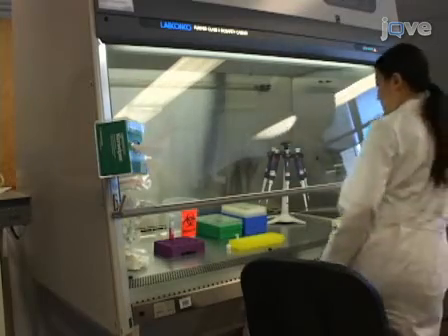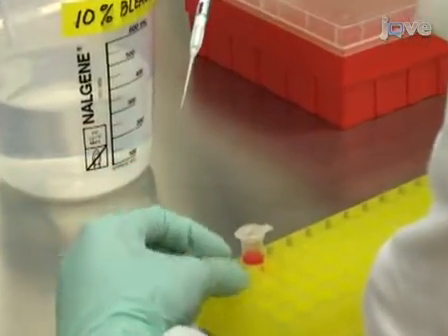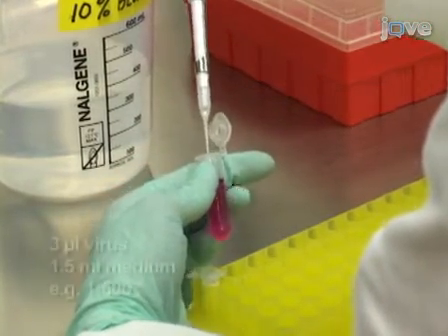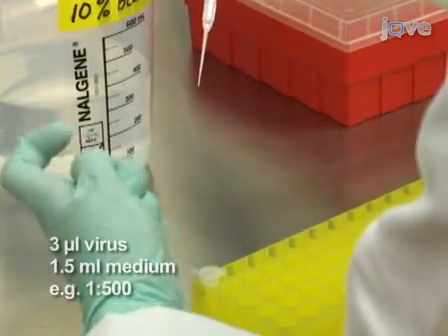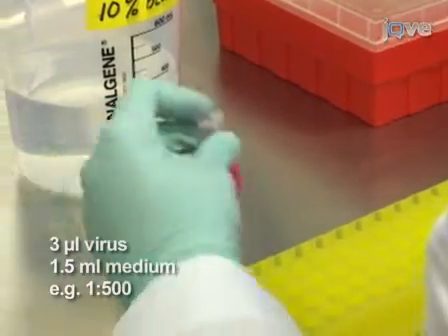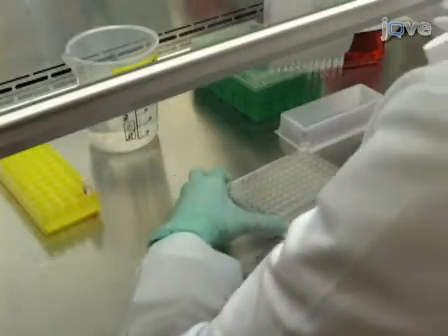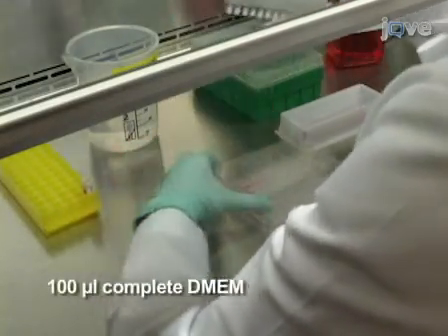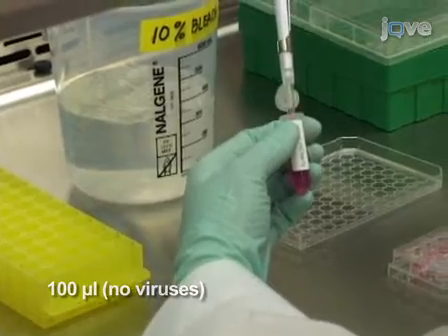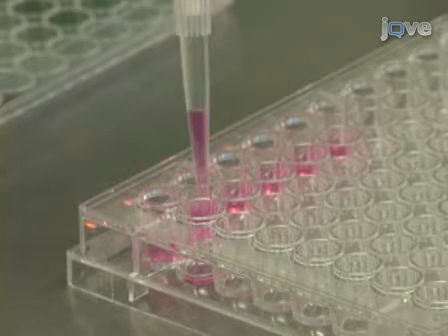The next step is to determine the viral titer. If you have included a fluorescent reporter gene in your lentiviral plasmid, infected cells will fluoresce and you can determine the viral titer using flow cytometry. To begin, dilute 3 microliters of concentrated virus into 1.5 milliliters of complete medium. In wells 1 to 6 in a single row of a 96-well plate, perform the following serial dilutions. Add 100 microliters of complete DMEM to all 6 wells. To the 1st well, add 100 microliters of medium with no virus — this is your unstained control. To the 2nd well, add 100 microliters of the diluted virus.